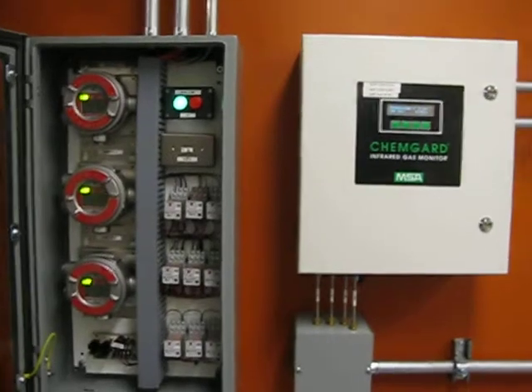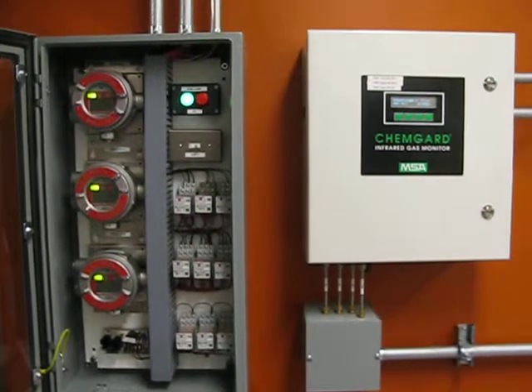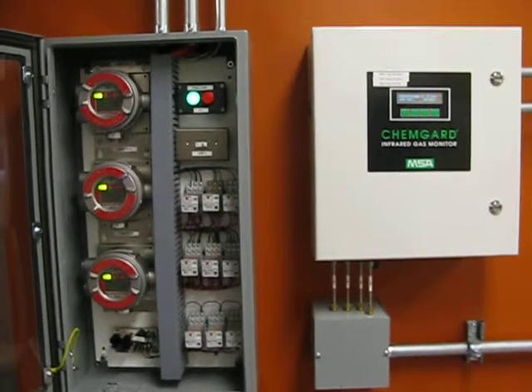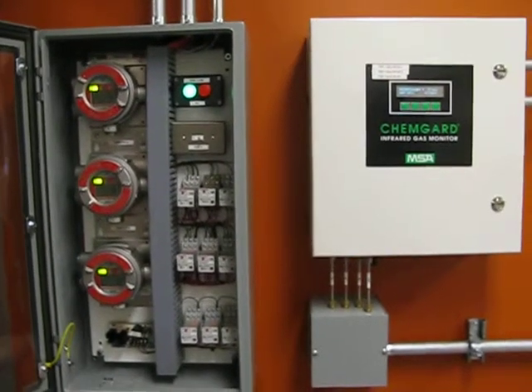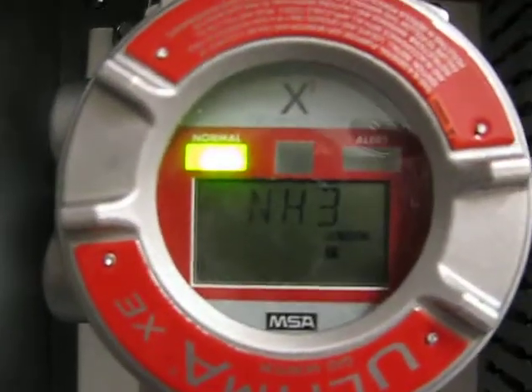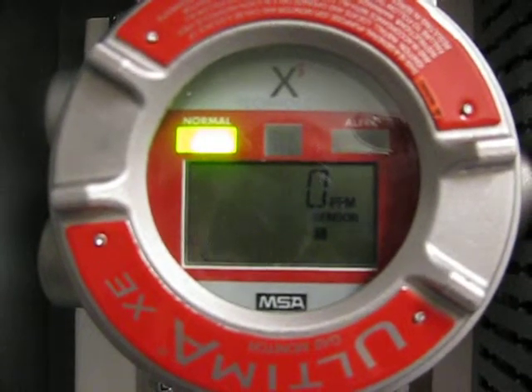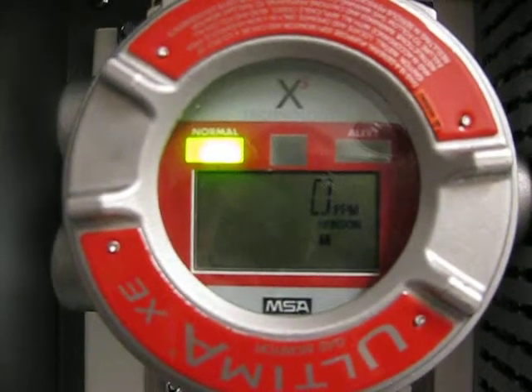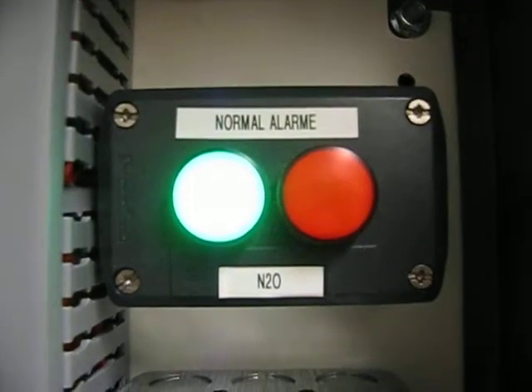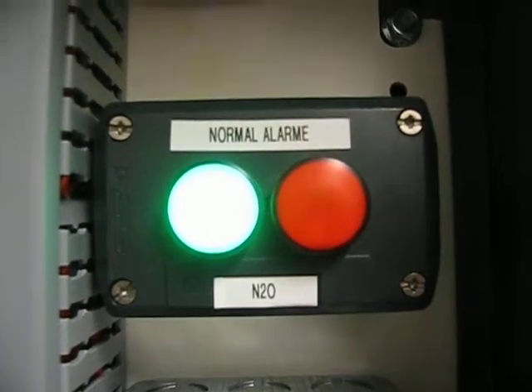These two cabinets must be checked before any entry into any of the clean room zones. Any alarm status will change the green light on the left to a red light on the right. The same is true for the N2O alarm adjacent to it.